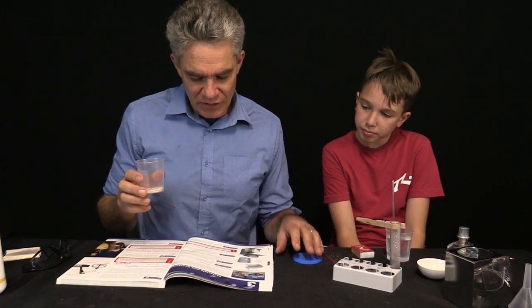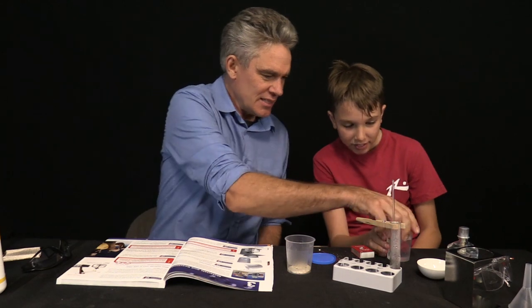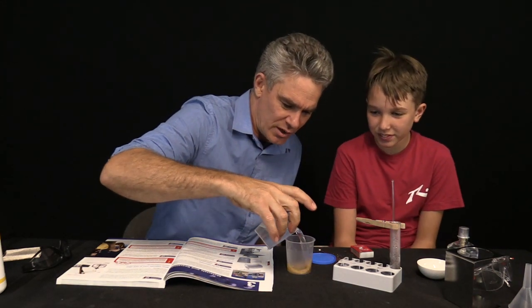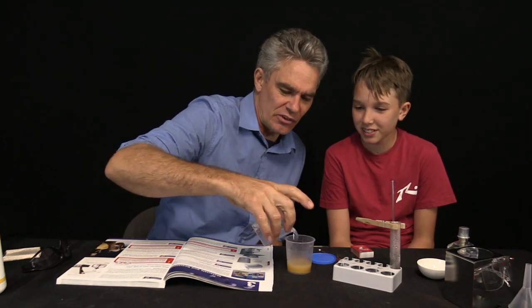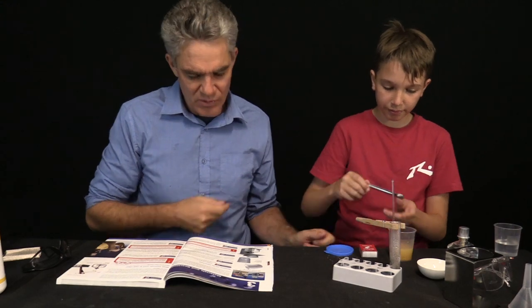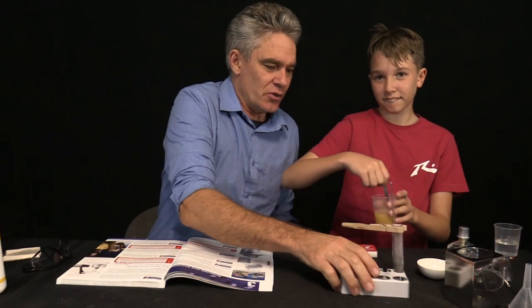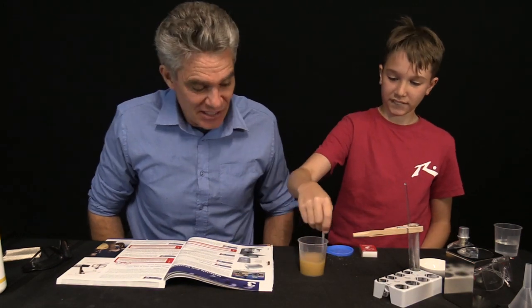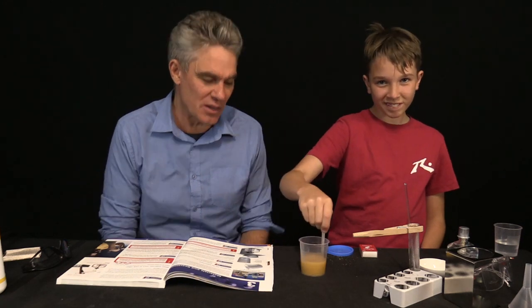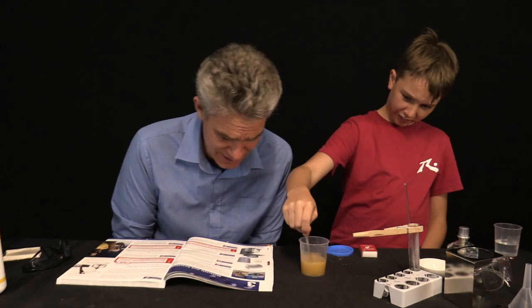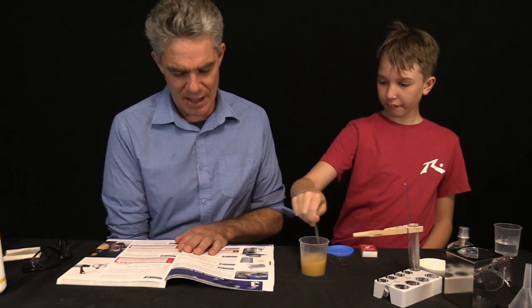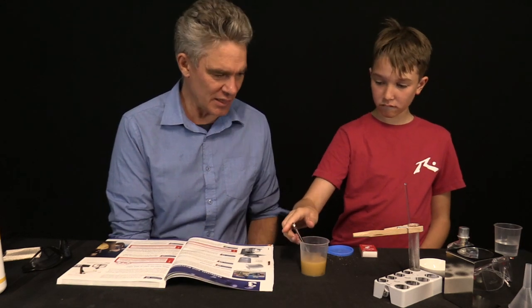Experiment number four, we need to add 50 ml of water. How many ml of water is in this container at the moment? About 100. So I'm going to pour in 50 ml. That's 50 ml. And it says, mix it with the spoon. Now fairly, it's fairly clear to me that that sand of ours is actually quite clay because you can actually see some very fine sediments that have come up. It's a little bit probably closer to a colloid than it is to a suspension.